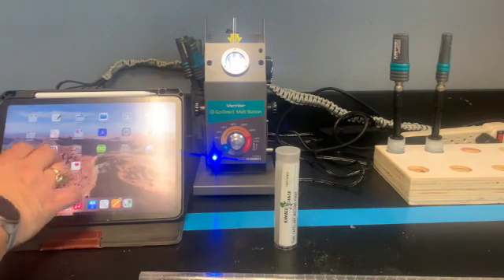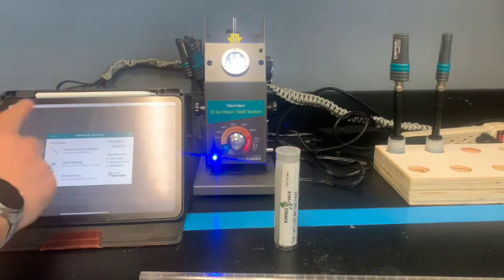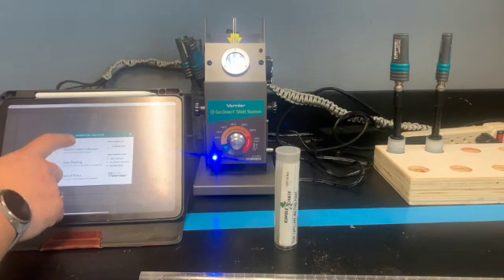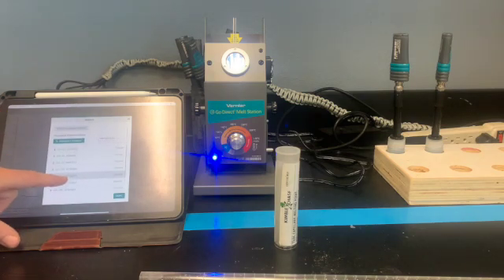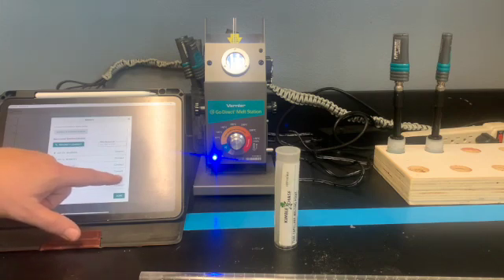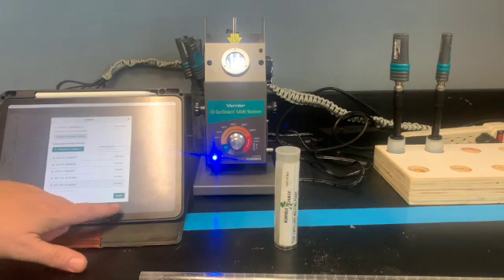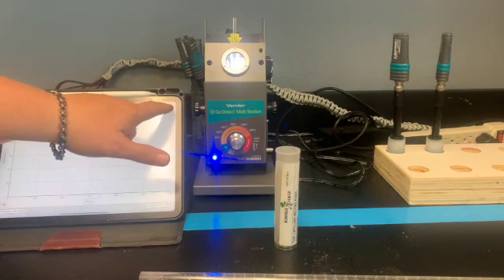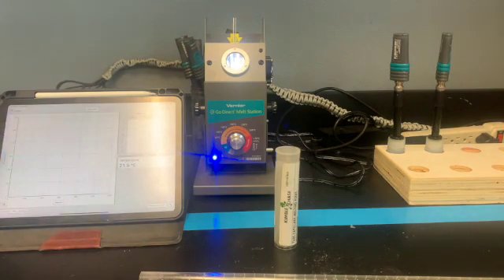Okay, we're going to connect the melting station. We're going to turn this on. We've not started the heating process. We're doing graphical analysis. We're going to do sensor data collection. Since you're so close to my charging station, you're probably going to come down here and find the one that says MLT. And I want to connect the MLT, otherwise you might connect some of the other probes. And it says done. And I want to be able to see my temperature. Okay, so that's connecting the probe.